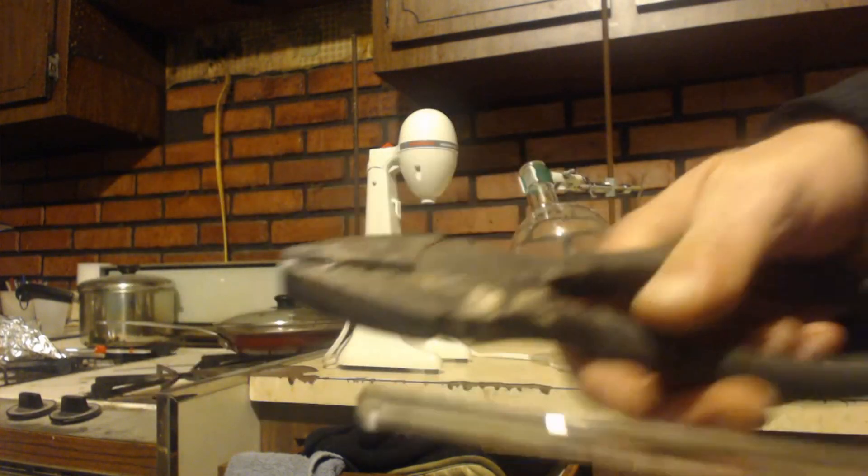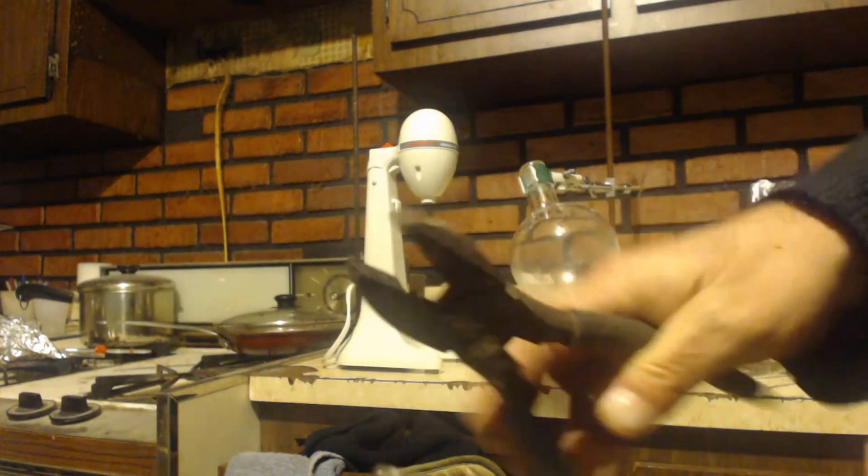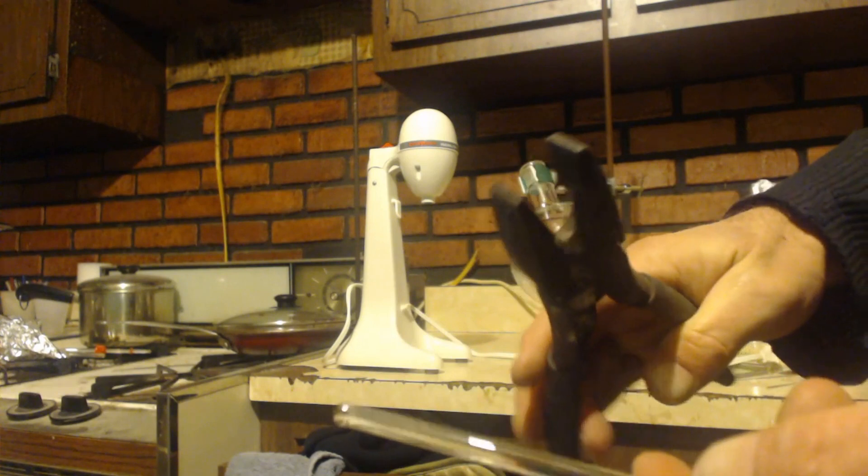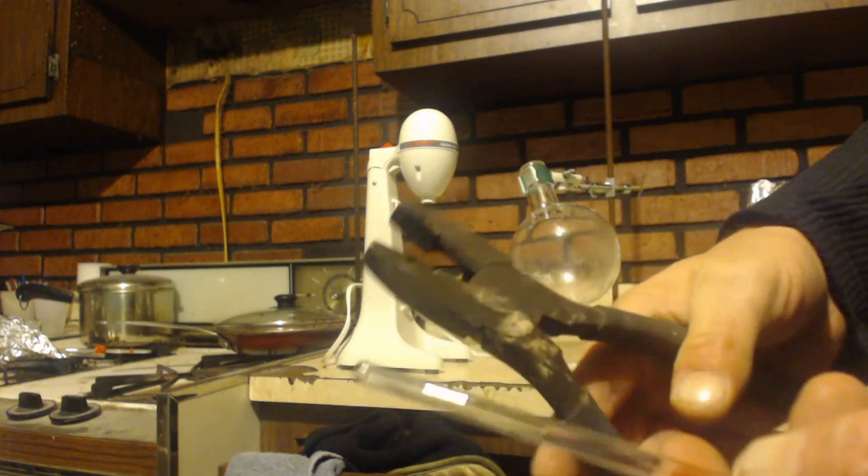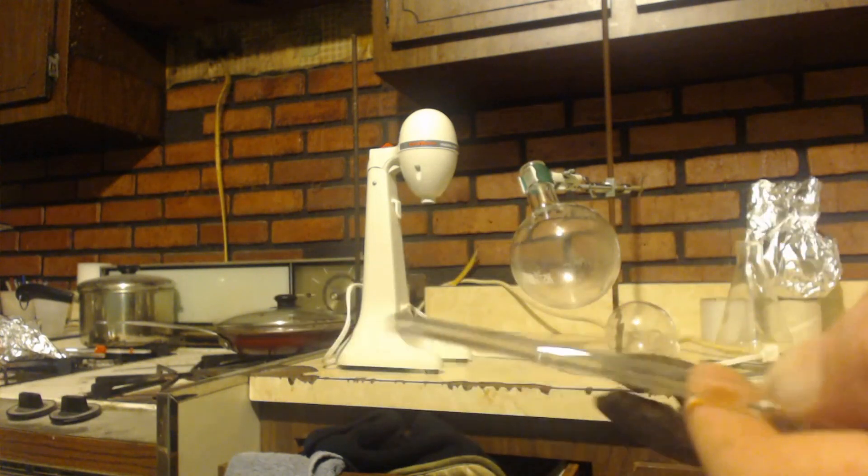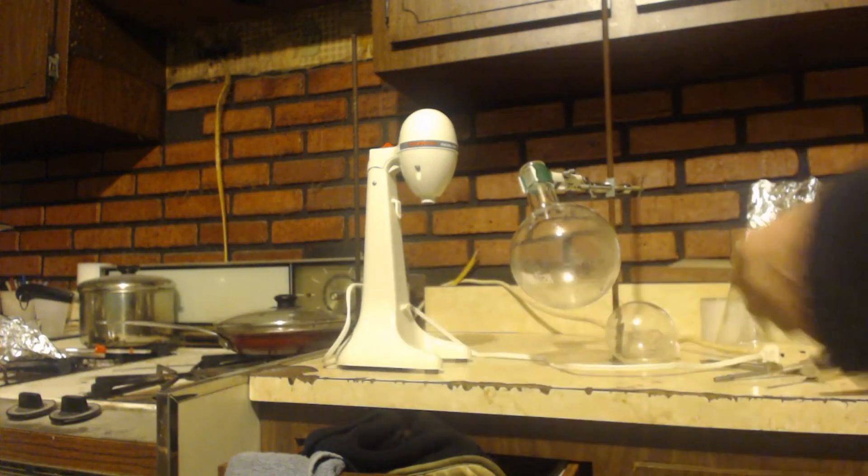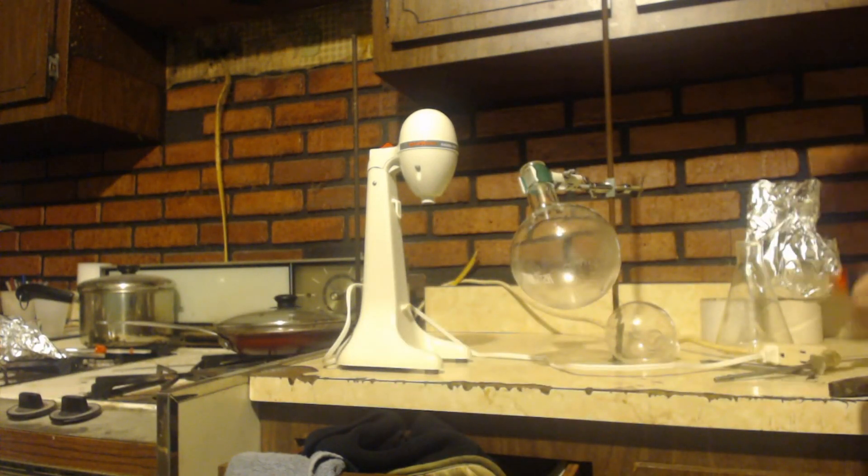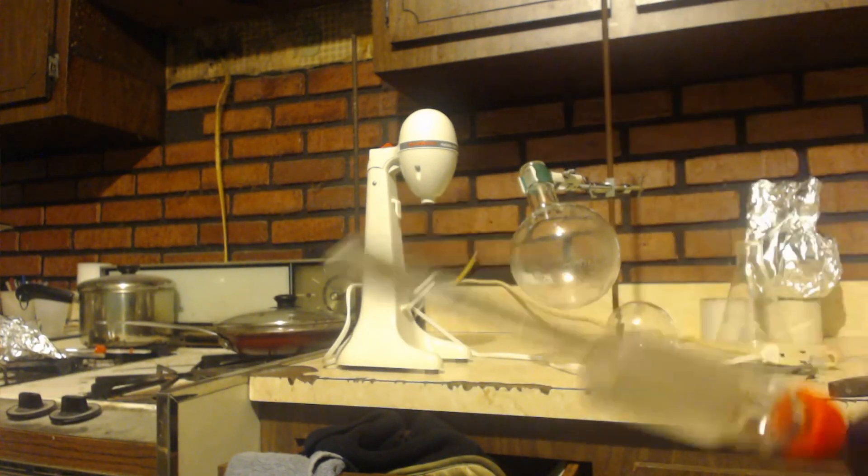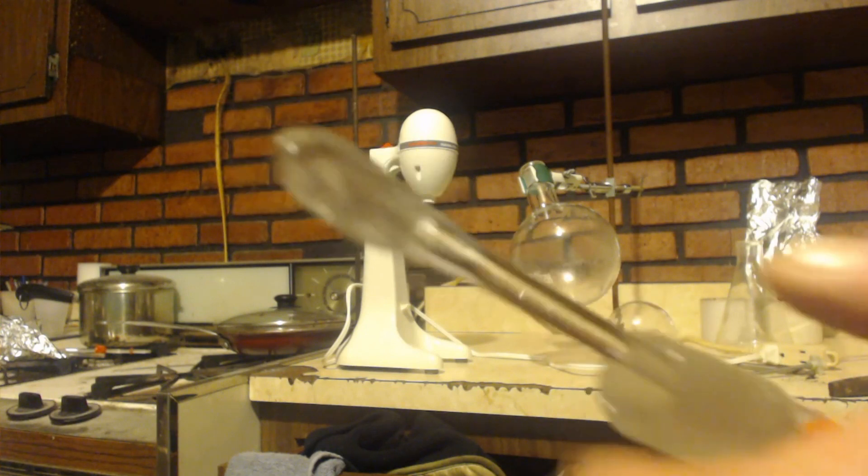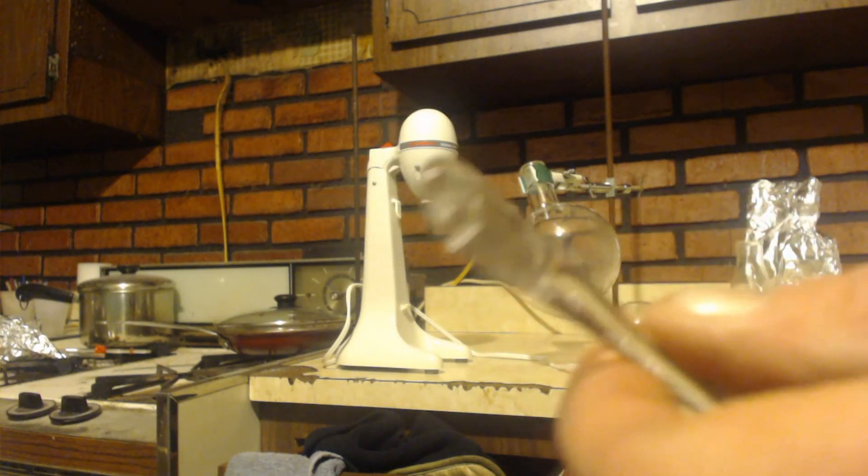And I heated that up and then I just crimped it with this. Unfortunately my pliers are really dirty and have a bunch of crap on them. I should have gotten some clean ones, so it made it kind of black. So I just squished it well apart and you can see I have like a leaf or whatever on the bottom of this.